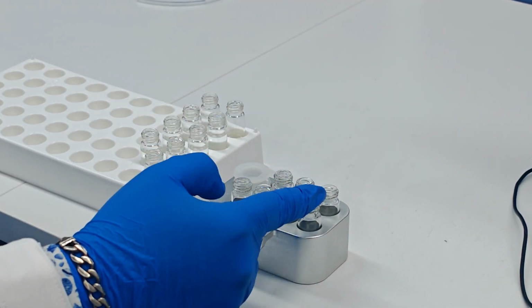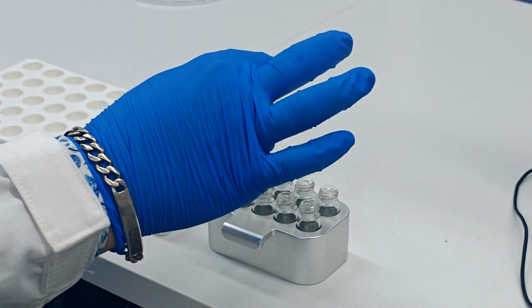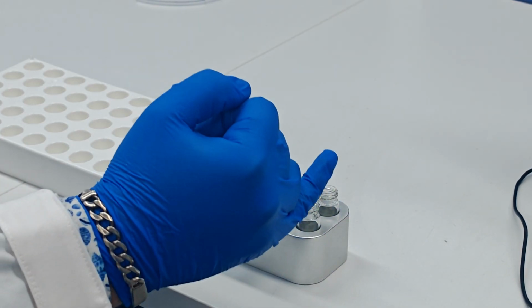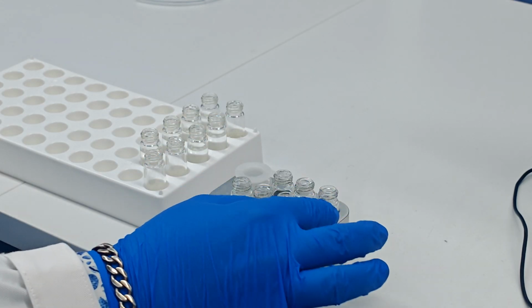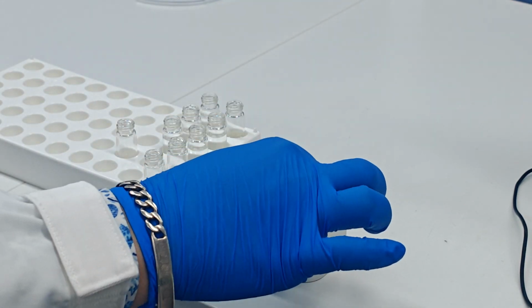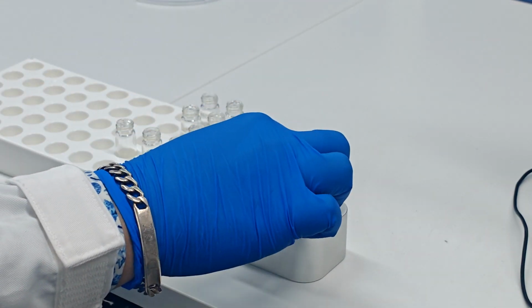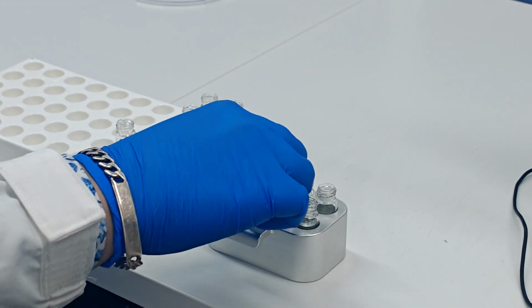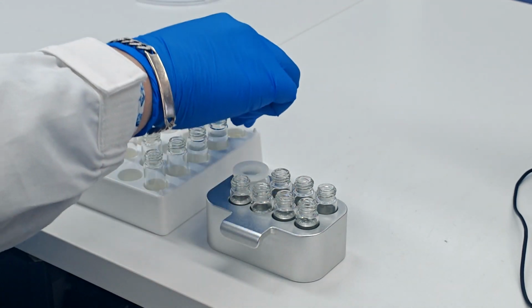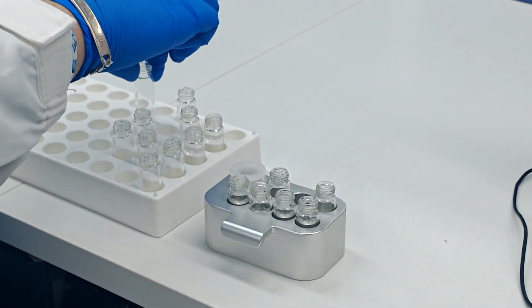As we can see, we have 7 samples plus 1 place for the buffer solution. We start numbering system for the samples from the most right side in the front. So these are sample 1. We can change this for different concentration of our solution. This is sample number 2. We change this for another concentration, and we repeat the step for 7 samples as we are doing right now. As you can see, it's very simple and easy to put the new samples in and out.